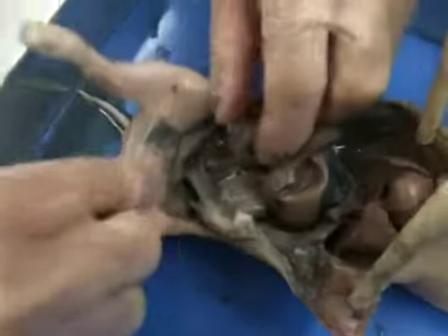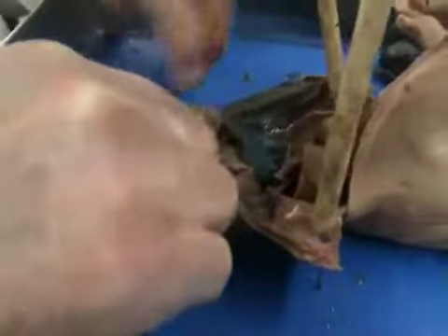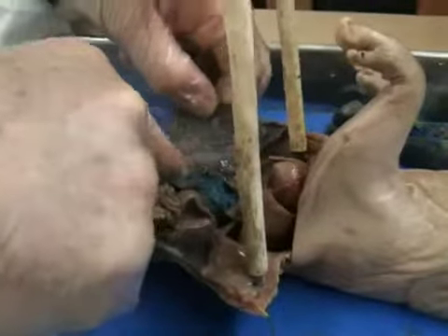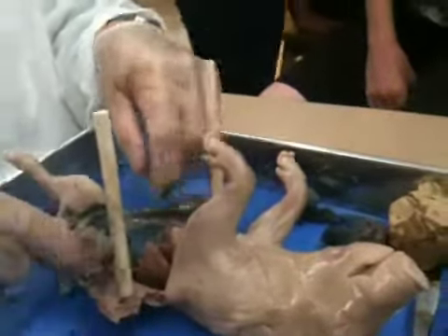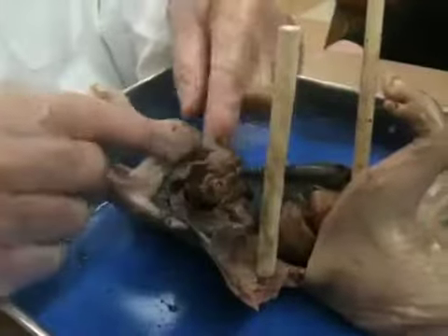If I stretch the small bowels apart, you'll see clear, thin tissue. It's not so apparent here as it was in some of the other ones. But it's this thin tissue on the inside of the muscle. All right? Now, this clearly is the small intestines, the small bowels.